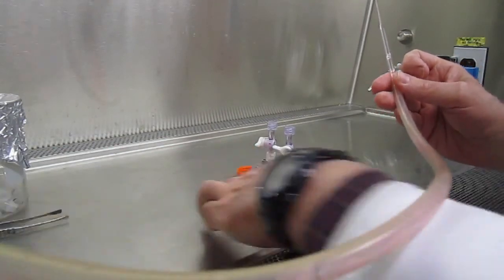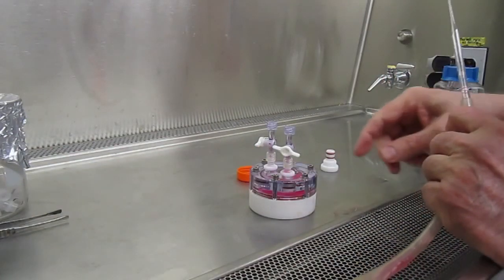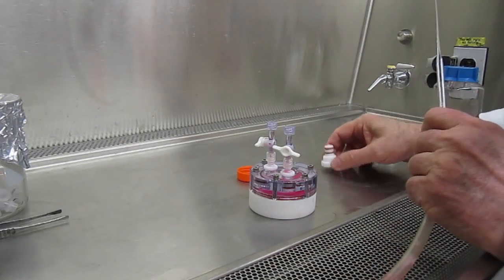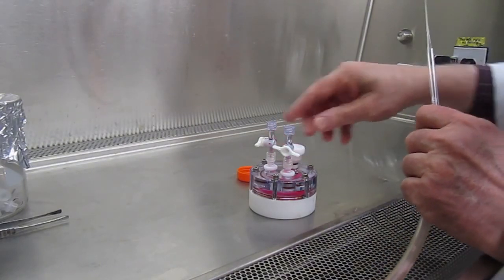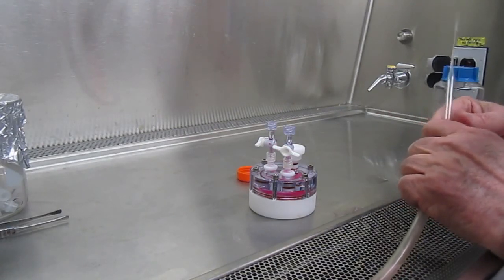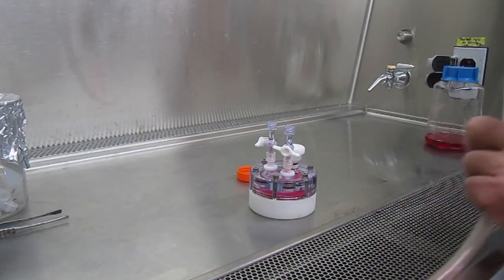Then the vessel is filled with media in the same way as we showed before. The fill port is replaced and the vessel returned to the rotator base in the incubator.